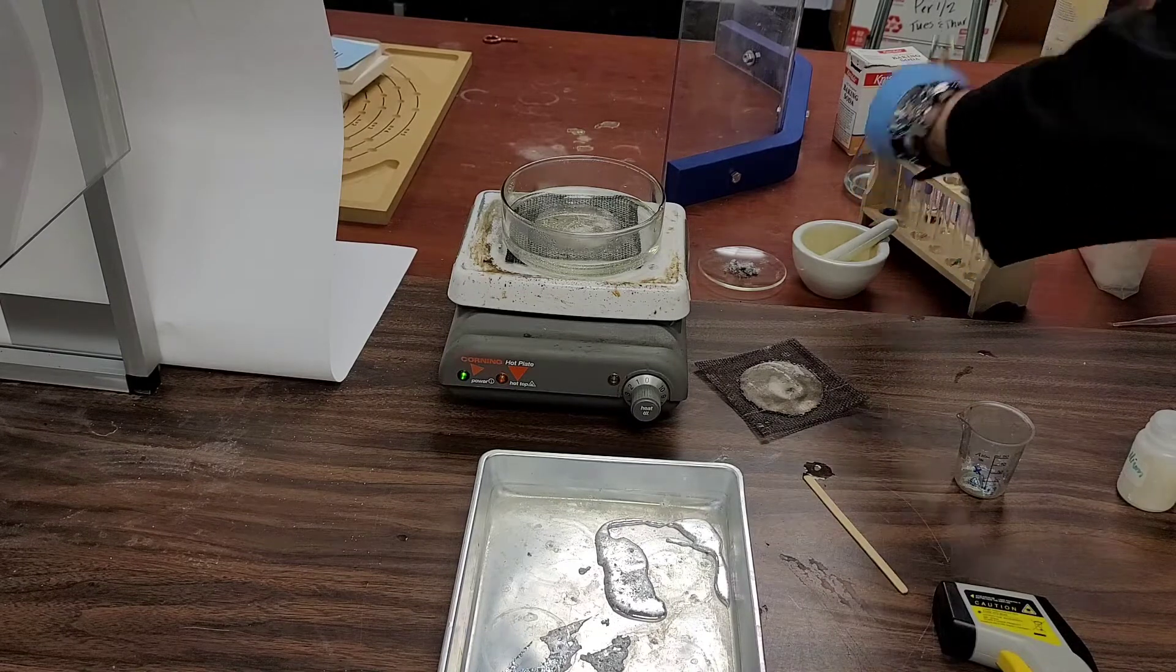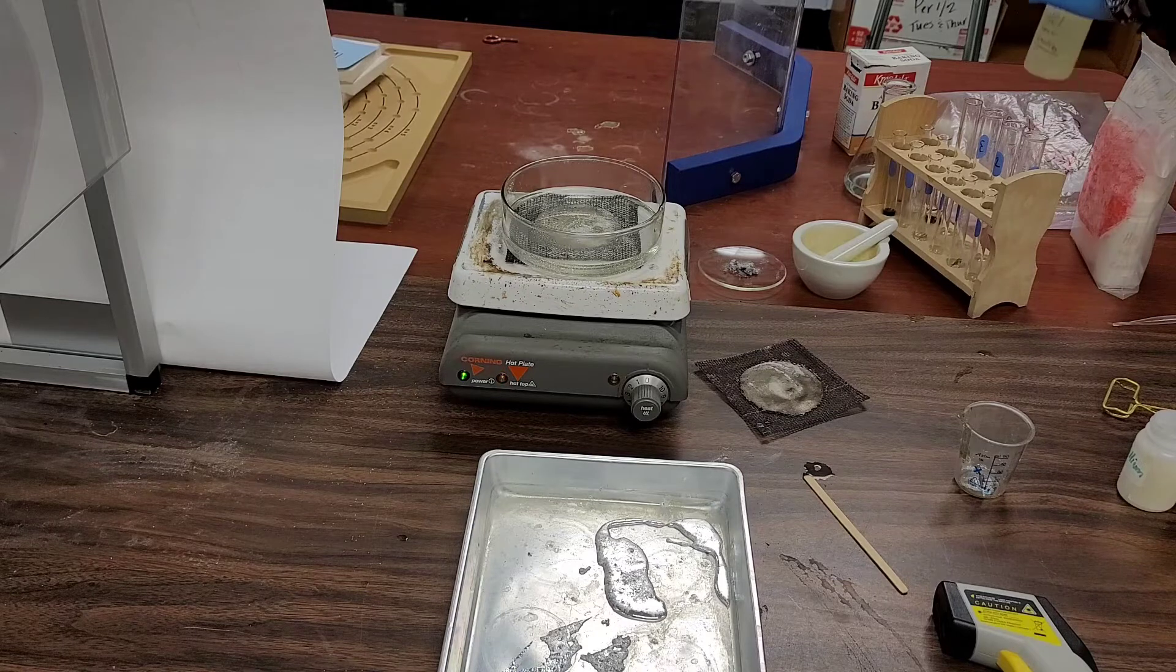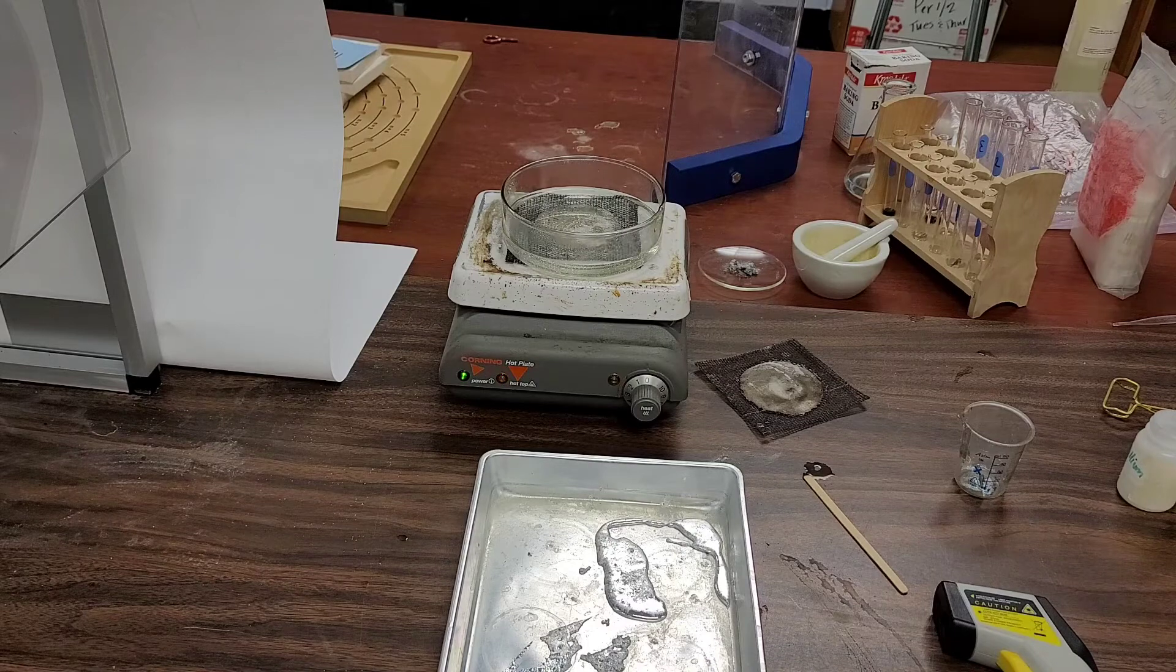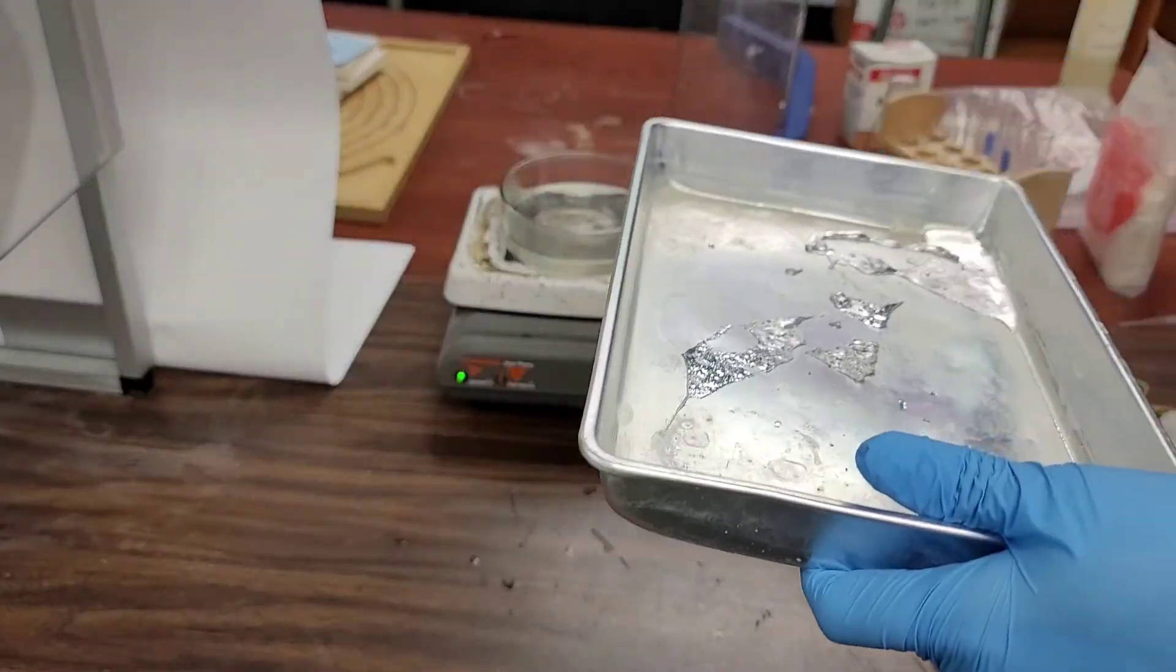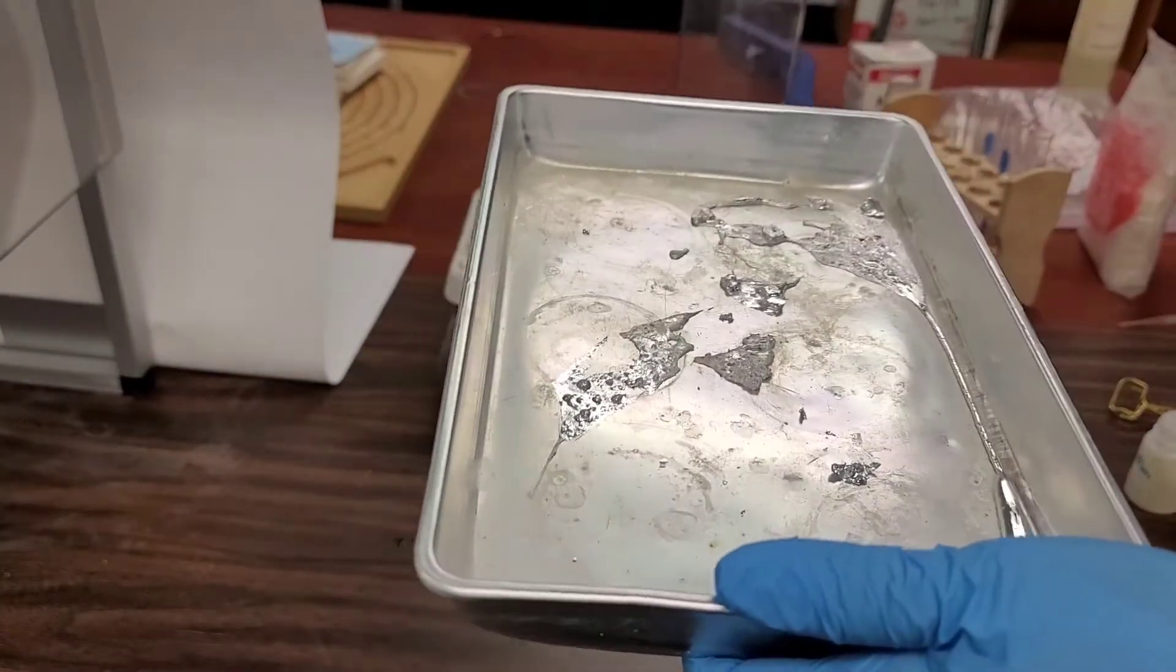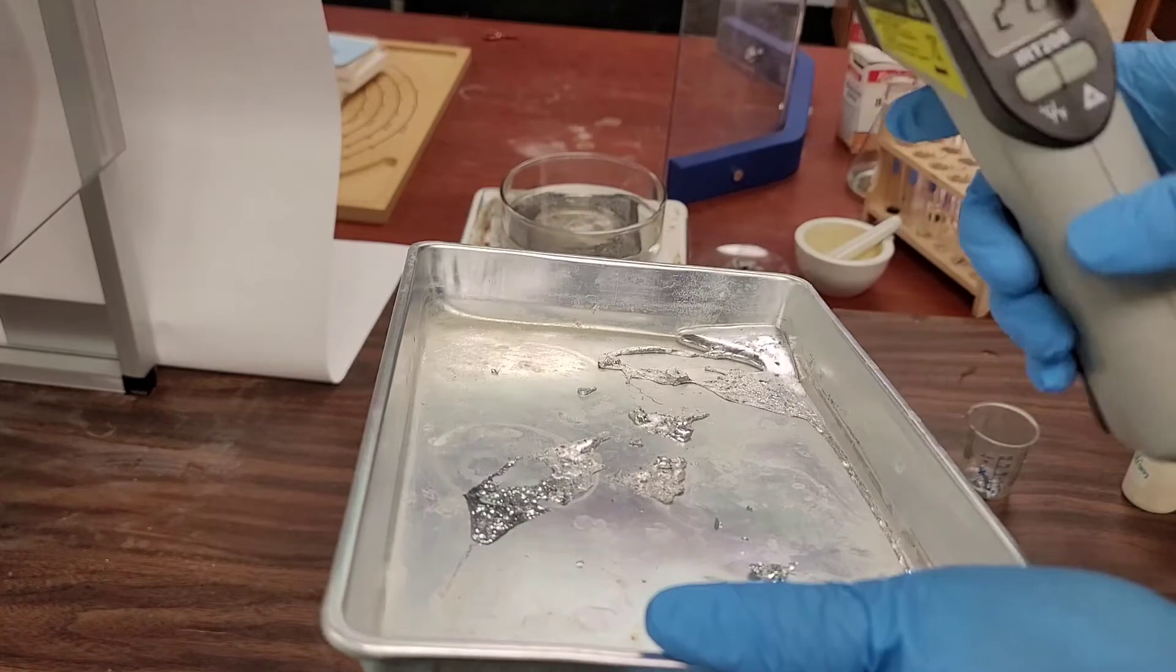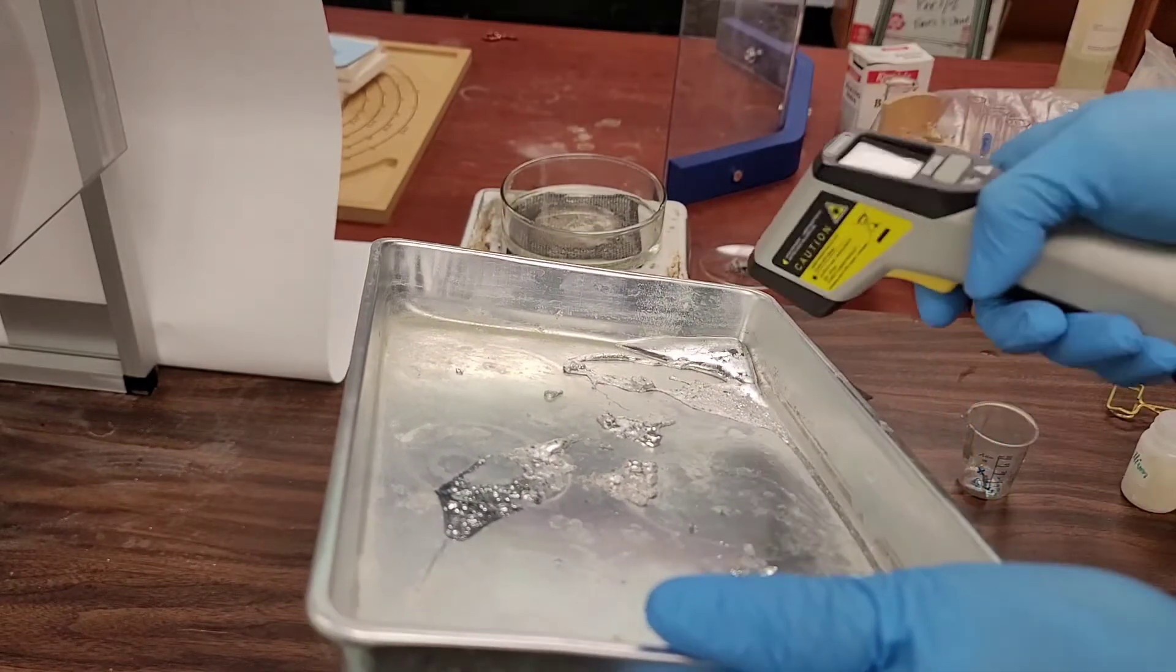A lot of metals do, but some do not react with hydrochloric acid. That's why I keep doing that test, because hydrochloric acid can be used as a standard to see how reactive a metal is. So if a metal is pretty reactive it will react with hydrochloric acid. If a metal is not very reactive then it won't react with hydrochloric acid. Oh, here we go, anybody see it yet? It's taking a while. And try one more time to get the freezing point, still getting 27.5 degrees but before I got 31 degrees.